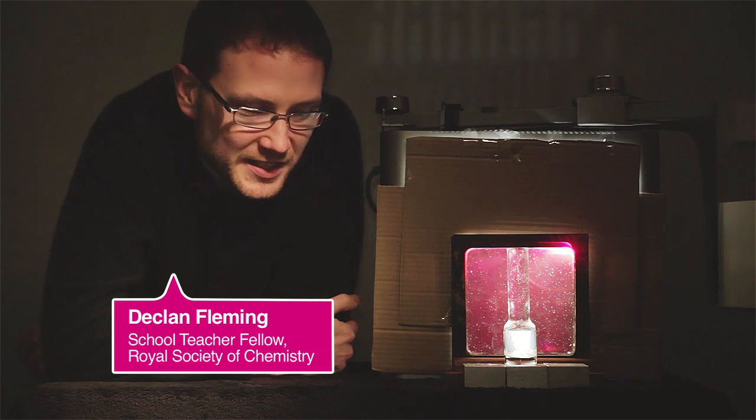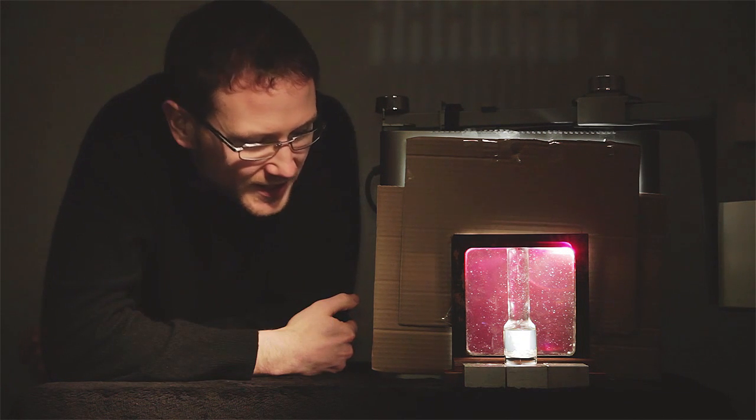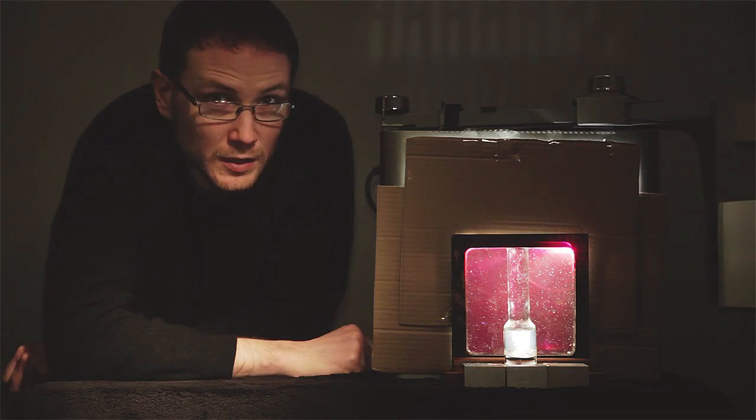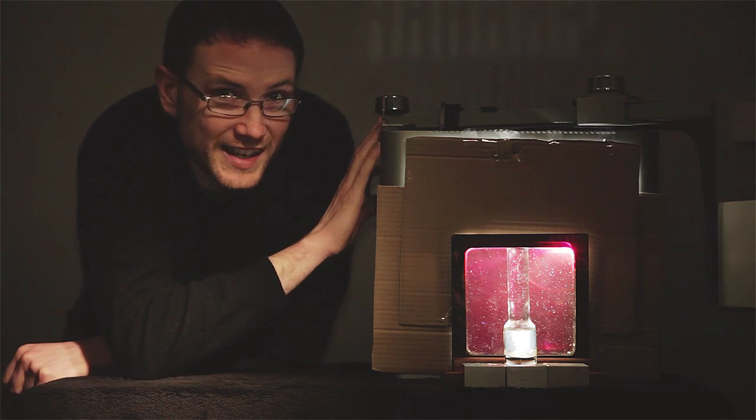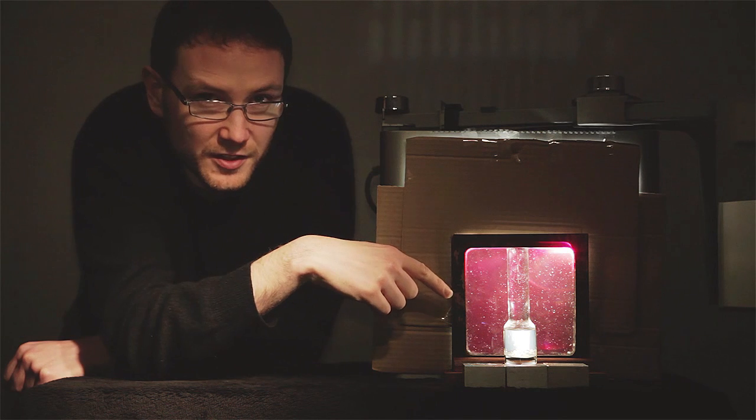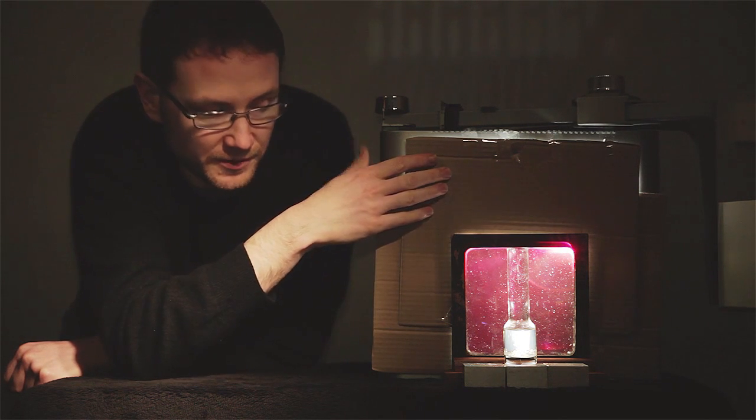There's no chemical reaction taking place here, so why is it that the liquid in this flask appears to light up when I place it in front of this filter? Well, I have a backlight, in this case an OHP, and I'm blocking all of the light that isn't passing through this filter with a piece of cardboard here.